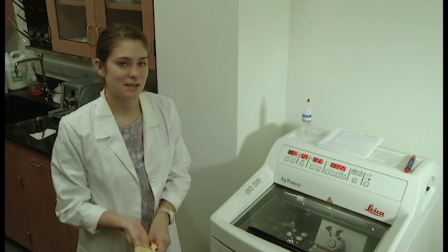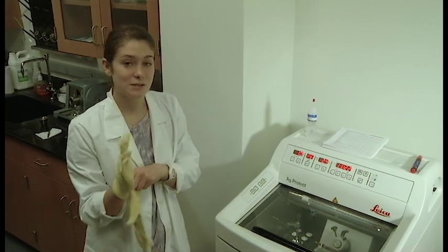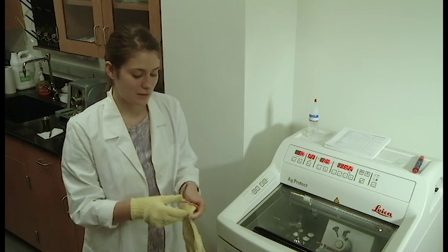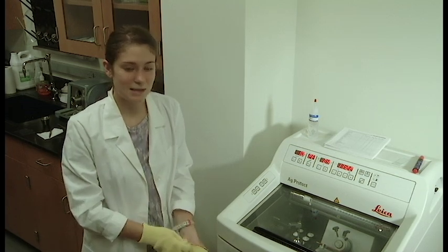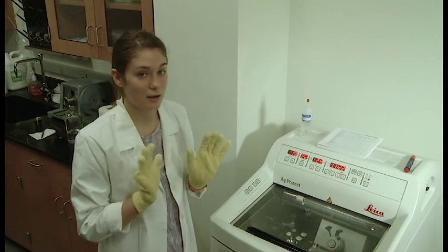Alright, before you use your cryostat, there are several things you should be aware of. First of all, you should always be wearing these gloves for your safety whenever you work inside of the machine as there is potential for frostbite if you are not using gloves.